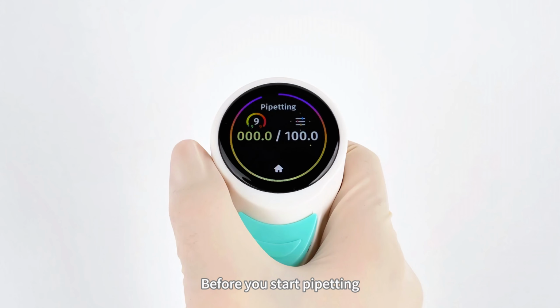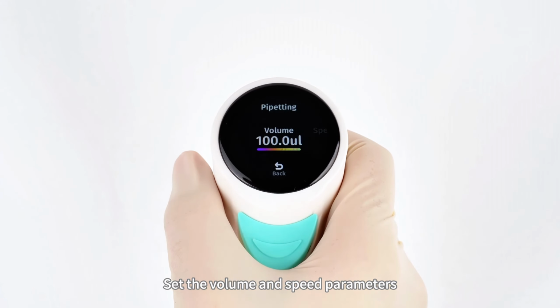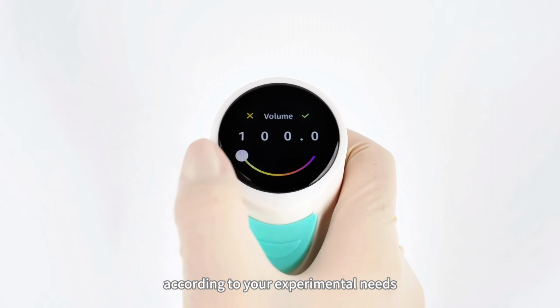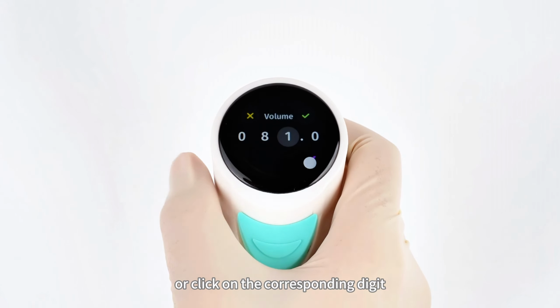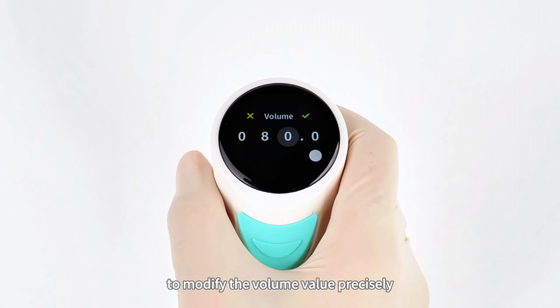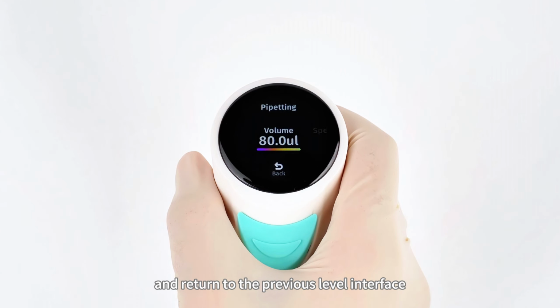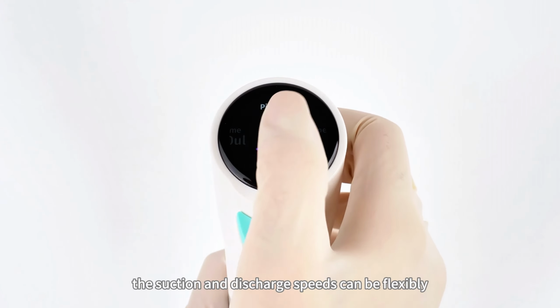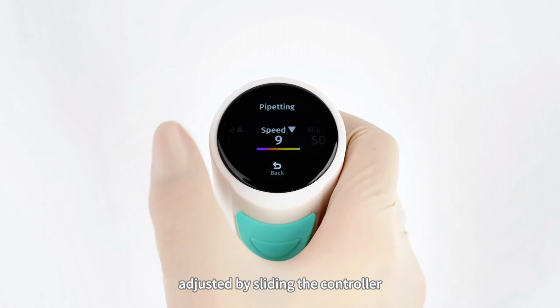Before you start pipetting, click on the upper part of the screen to enter the parameter adjustment interface. Set the volume and speed parameters according to your experimental needs. Slide the controller or click on the corresponding digit to modify the volume value precisely. After completing the settings, click Save at the top or press the trigger button to save and return to the previous level interface. At the same time, the suction and discharge speeds can be flexibly adjusted by sliding the controller.